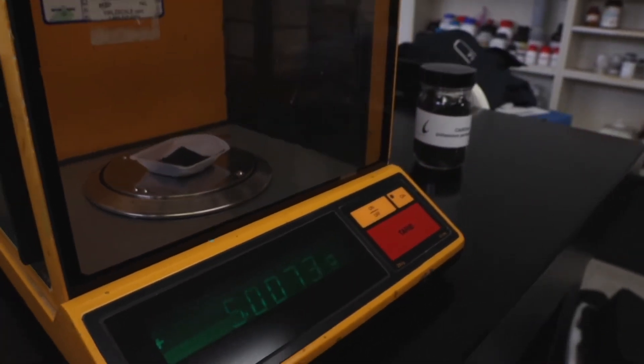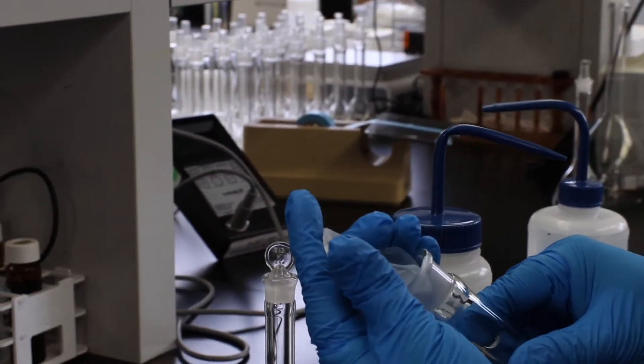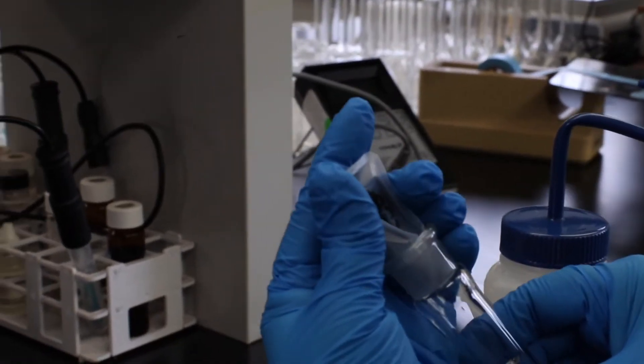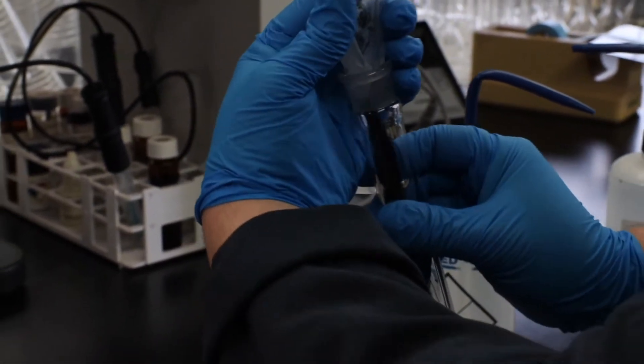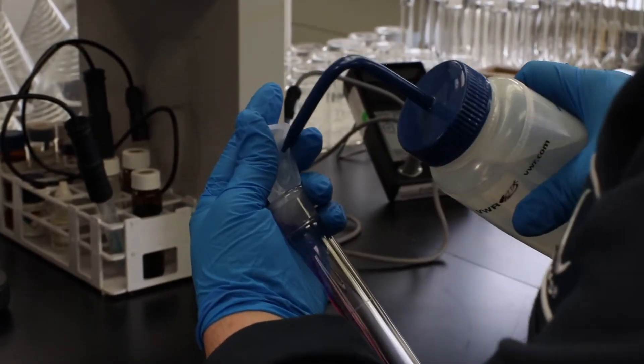When weighing out the Cairox, please make sure to rinse the weigh boat into the container and volumetric flask when transferring the dry permanganate to the volumetric flask.